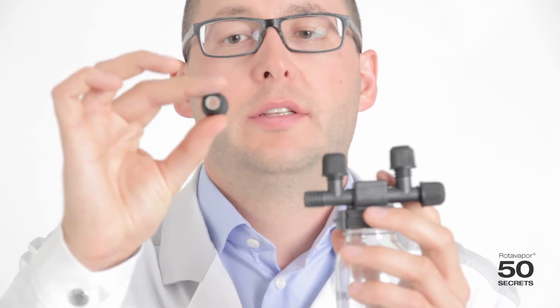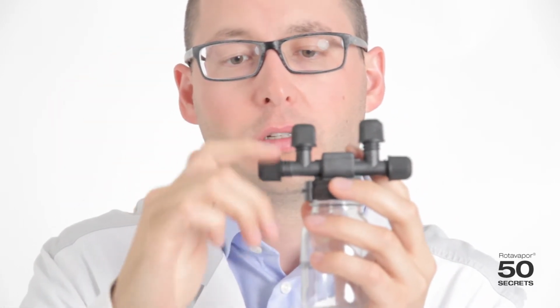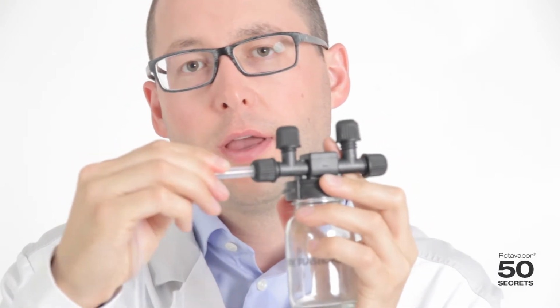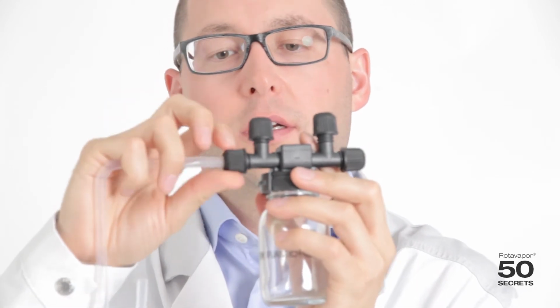The second step is to screw this cap with the sealing gently to the connection, just like this. The third step is to push this hose into that hole, like this. And the last step is to fix it here.